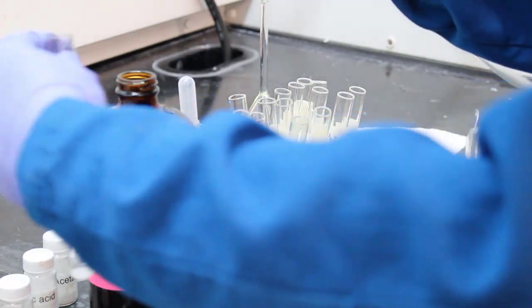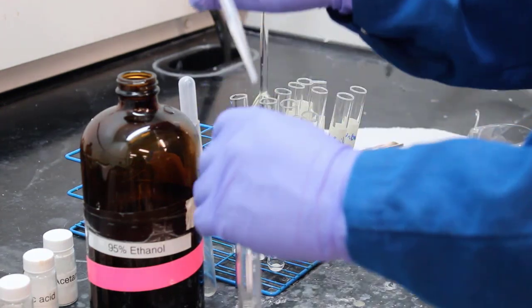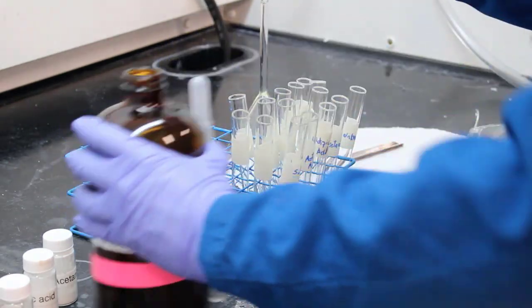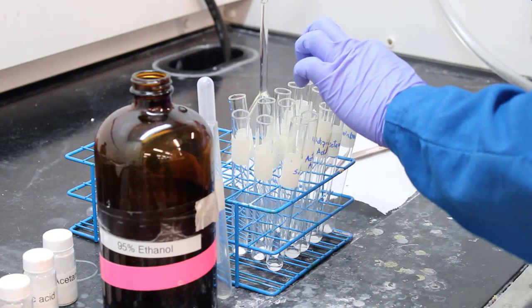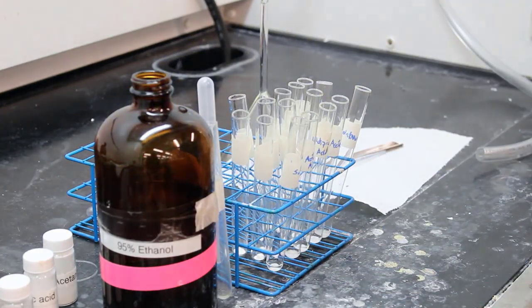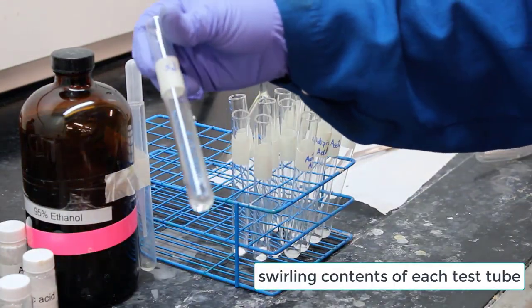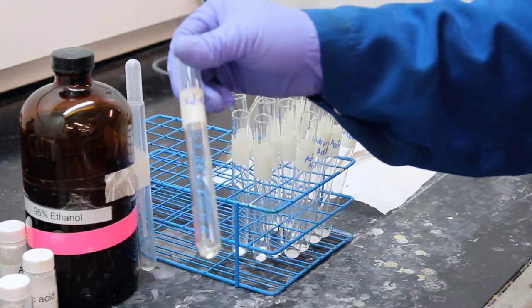So now what they're going to do, for one set, they're going to add ethanol to all of their different compounds, one at a time. All right. So looking here, we have ethanol. Does it dissolve if we swirl? So for salicylic acid, yes, it did dissolve it.